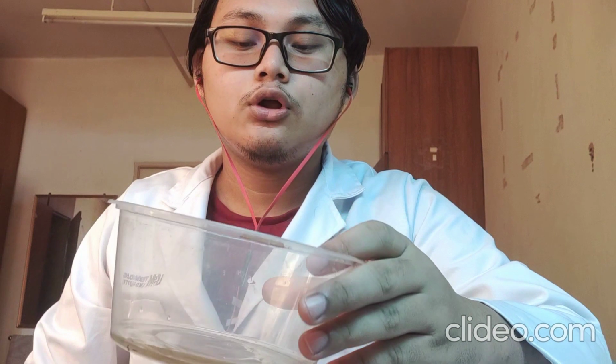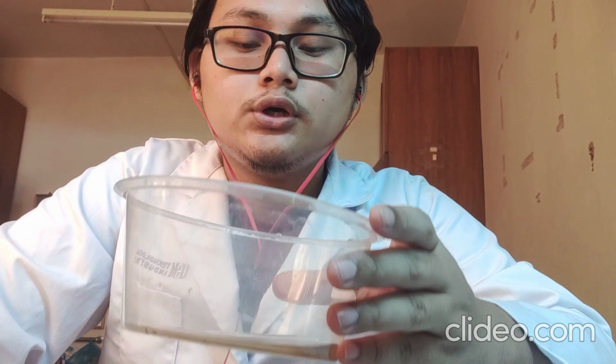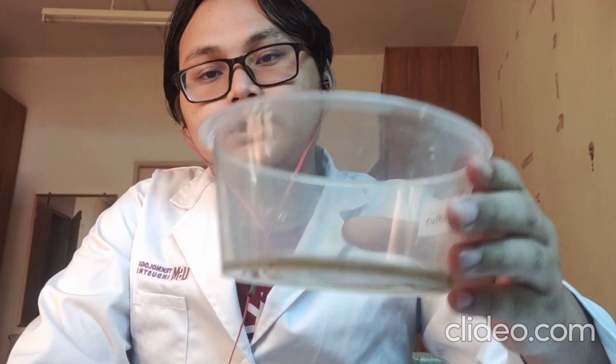Okay, after that, make sure all the trypsin touches all the surface of these vessels to make sure all the cells are detached before we incubate. After that, we will incubate this container for 2 minutes to make the process of detaching the cells faster. After that, we will observe it in the inverted microscope to check for the dispersion. If the cells are dispersed properly, we continue to the next step.